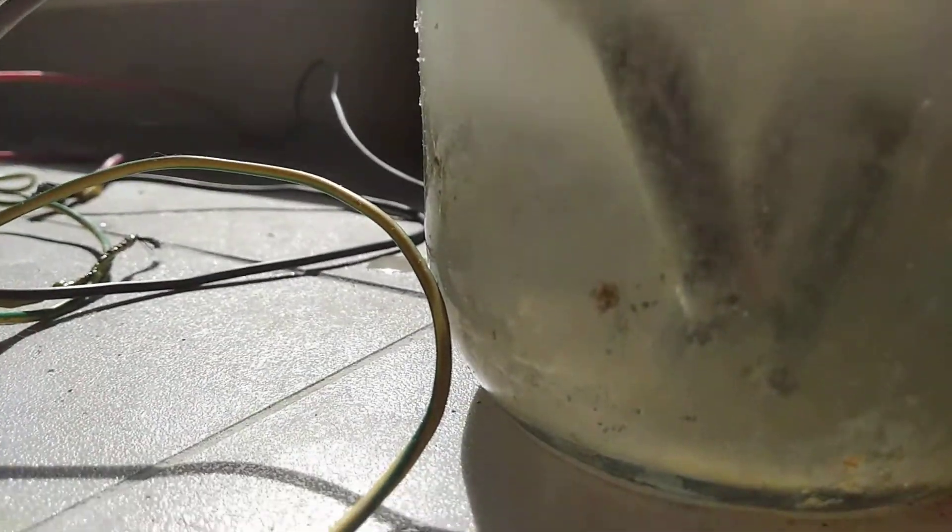Now the thing with graphite is that if the pH were to get too high it would start eroding, but it's been two hours and usually by now the thing would have eroded.